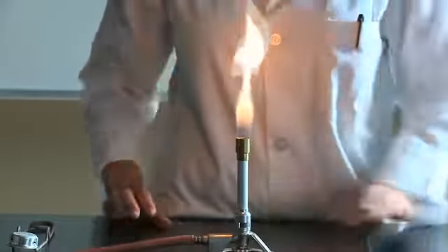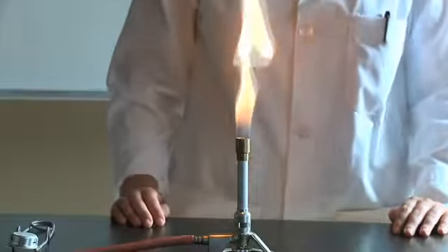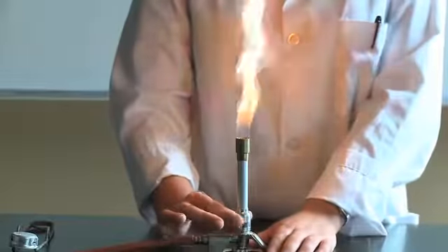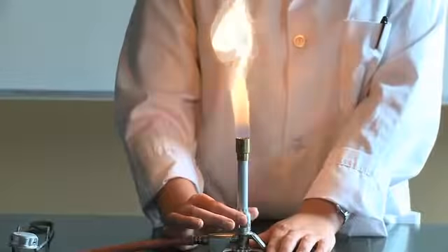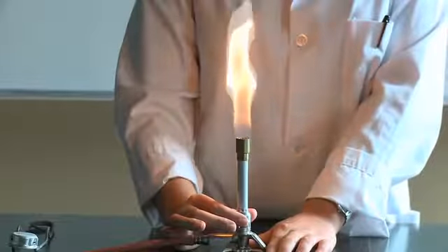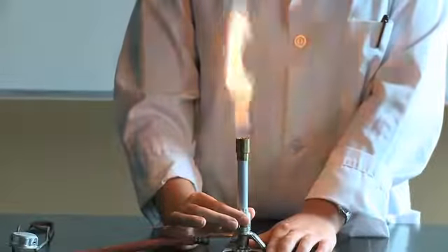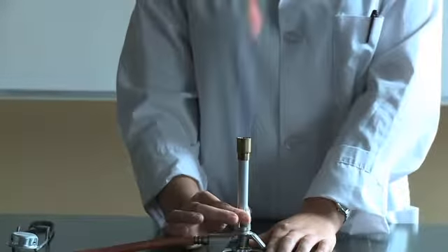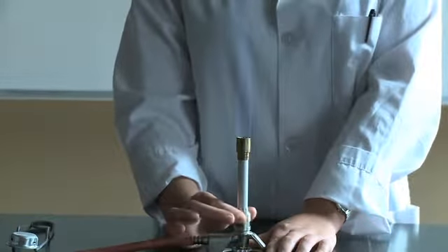Once you have your flame at a sufficient height you'll want to adjust the heat. To make a hotter flame you'll want to turn the barrel. Do this by holding it at the base. To increase the heat you'll want to turn the barrel counterclockwise. This should change the color of your flame from the yellow orange to blue.